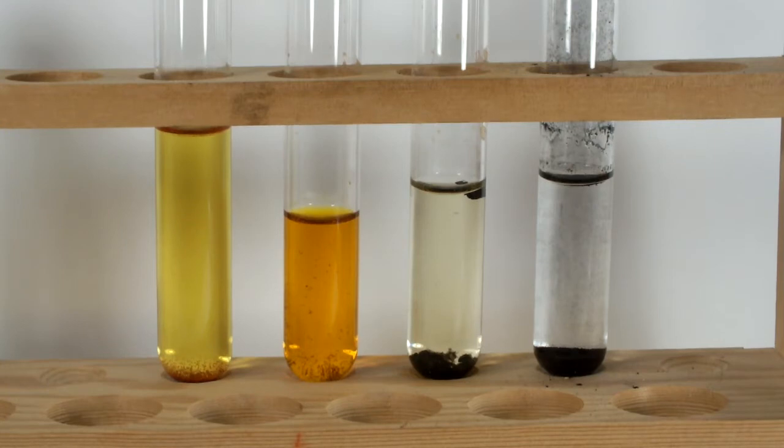Given some extra time, the activated charcoal did a better job. The trouble is that when you're dealing with industrial quantities of wastewater, a week is far too long for mediocre water treatment. The powdered decolorizing carbon still wins. As for the nitric acid, it's just too hazardous and there's an insoluble byproduct.